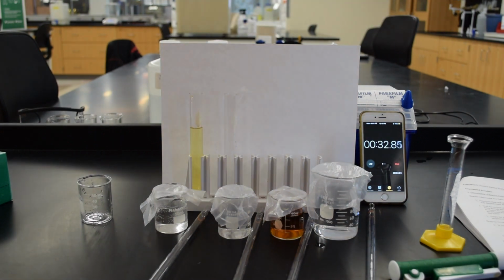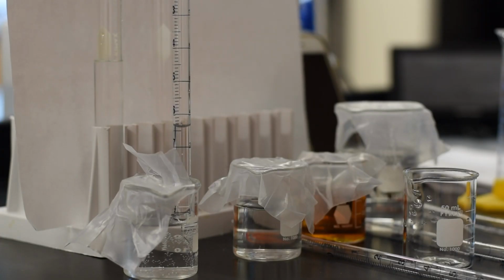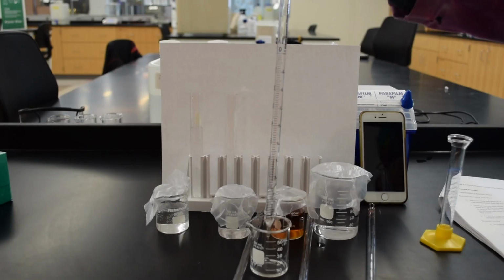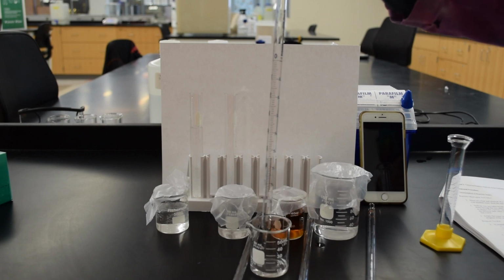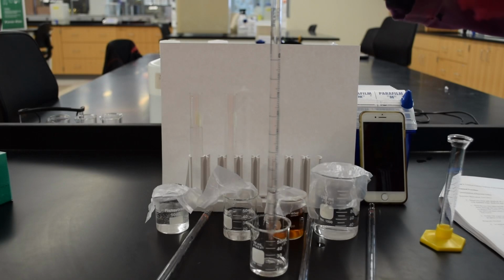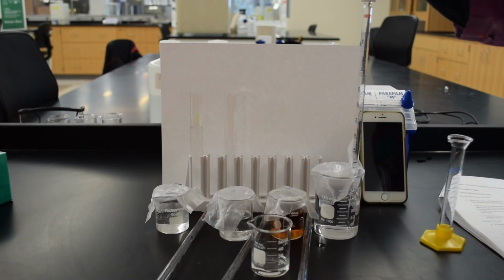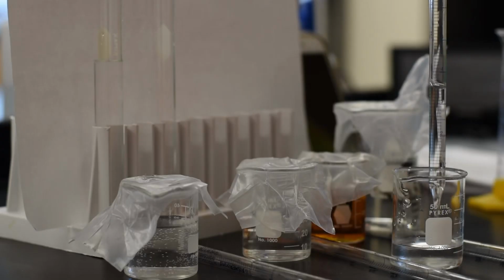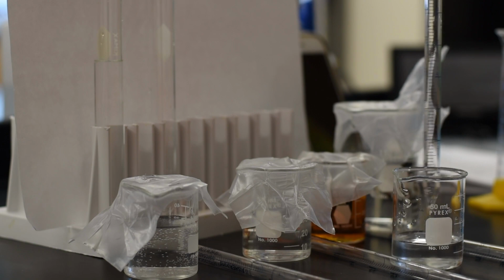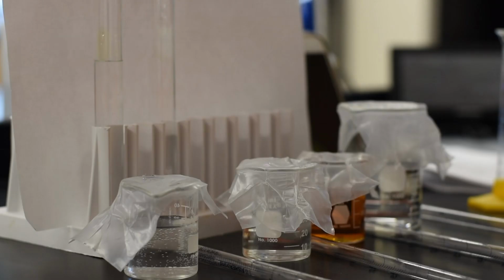And luckily, through the magic of editing, look how fast we can make it go. And we're done. So now we are on to the next step. And what is that step, you might be asking? We are going to do that exact same reaction with the exact same amounts again, but we want to know how long it actually takes to do it. But we need to be able to compare it with that control that we just did. So we need to have done that before. So we're going to do it again.